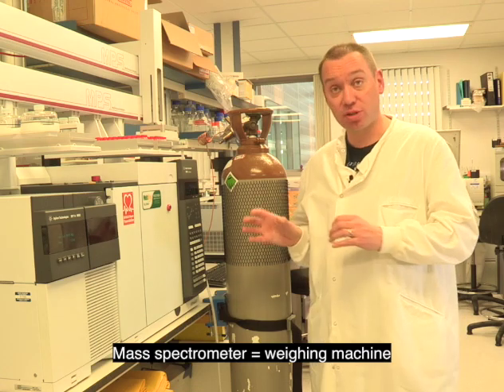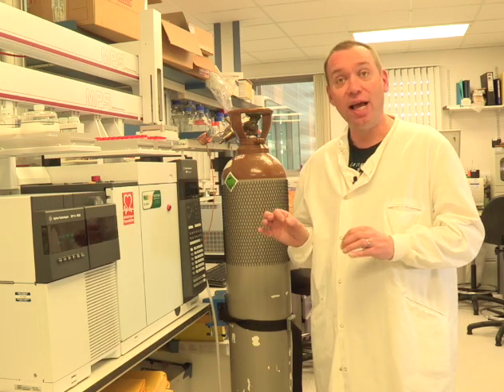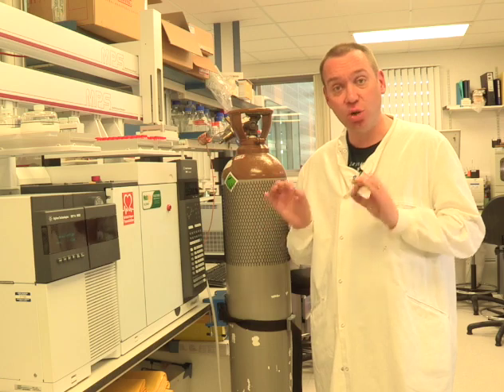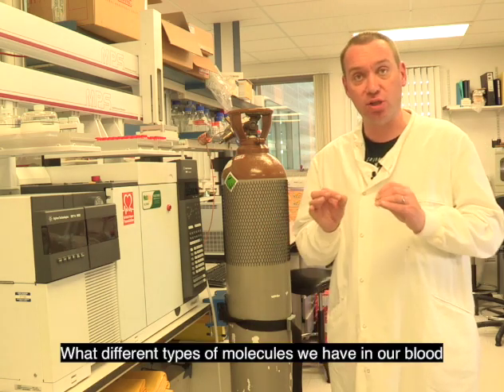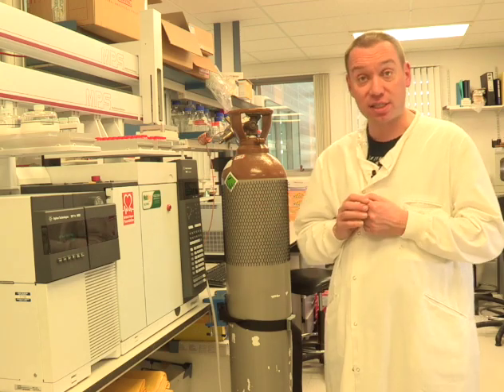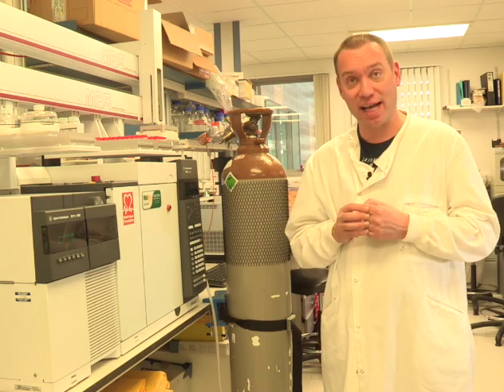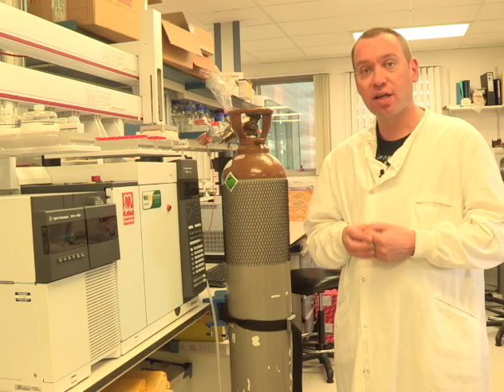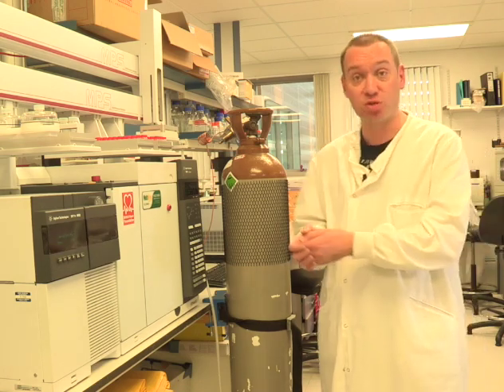A mass spectrometer is a very fancy weighing machine, and we use it because it's so good at weighing things it can tell us what different types of molecules we have in our blood. The ones we're particularly interested in in our research are fats. Different kinds of fats can be good for us and other kinds can be bad for us.